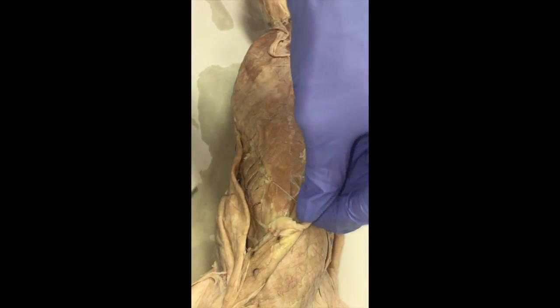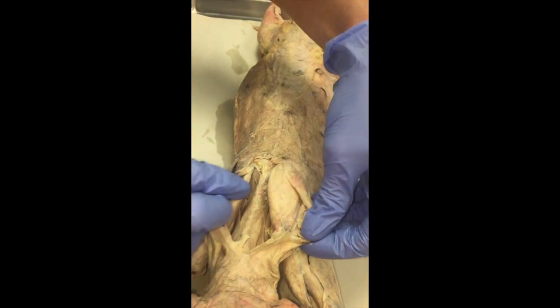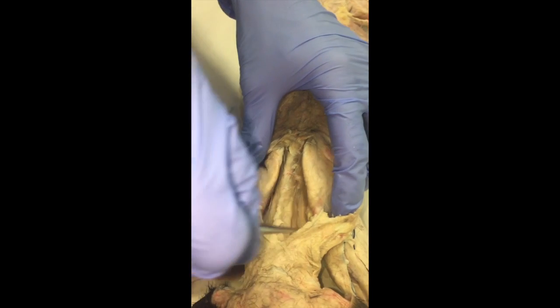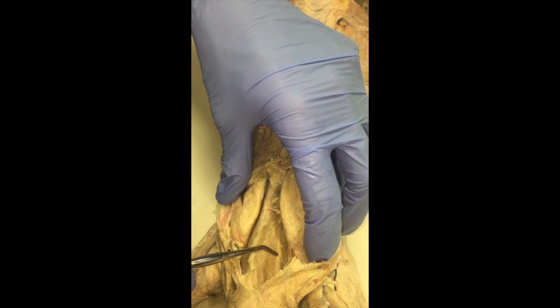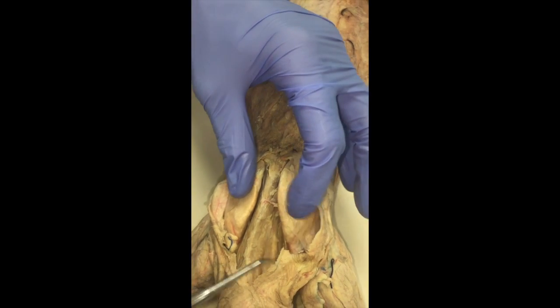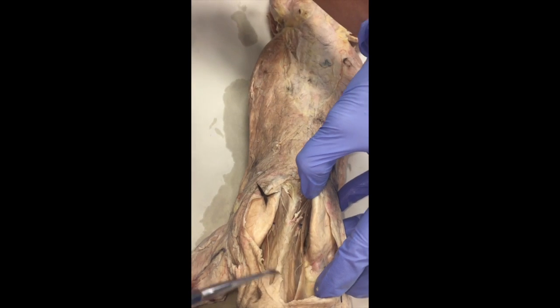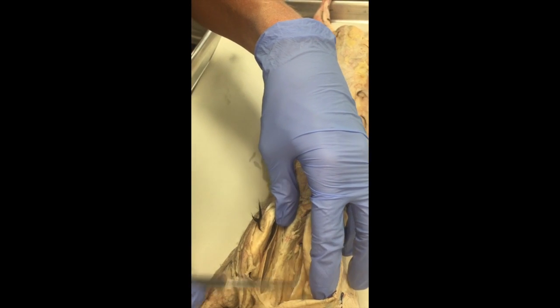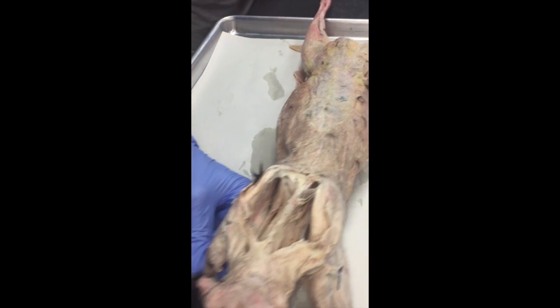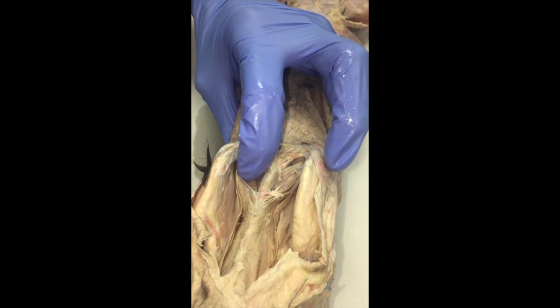Going back to the back again: once we pull back the acromiotrapezius, we can see this muscle right next to the spine — that is called the splenius muscle. Then we have rhomboidus capitis, which is this strap right here that goes from the rest of the rhomboids all the way up to the head. Rhomboidus capitis, if you lay it down, will lay on top of the splenius. It's part of the rhomboidus group, which are these filaments here — all of these are rhomboidus muscles.